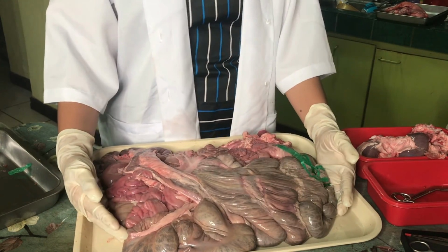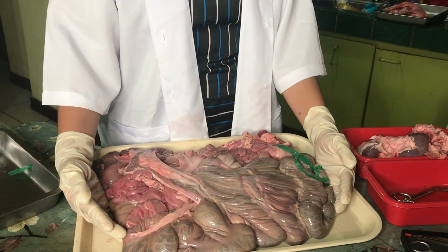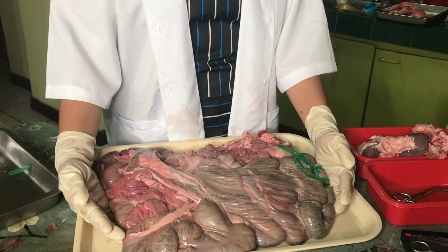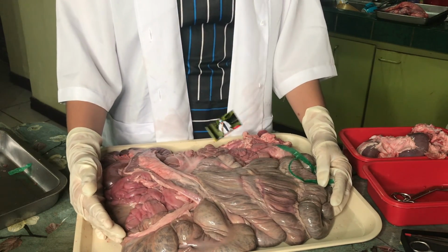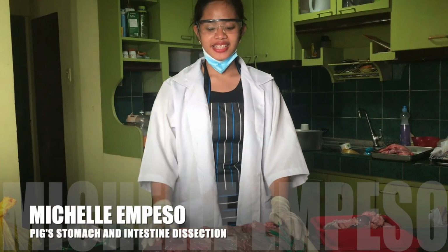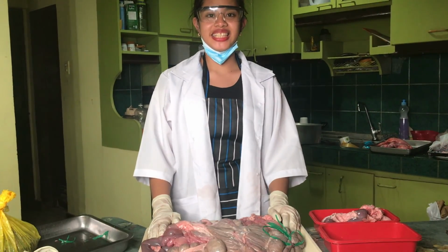So there are 4 parts of the large intestine: the cecum, the ascending colon, the transverse colon, and the descending colon. And that ends my small intestine and large intestine dissection.